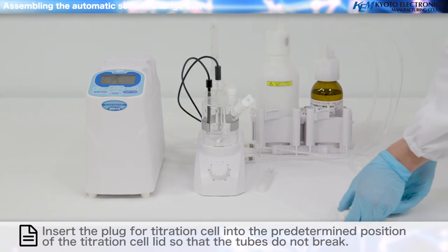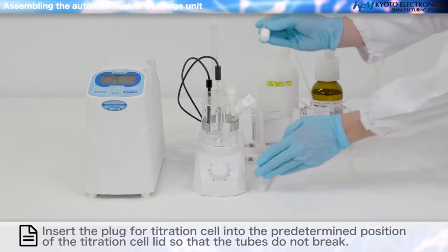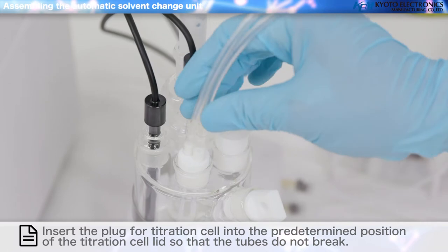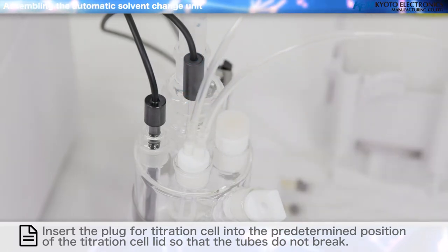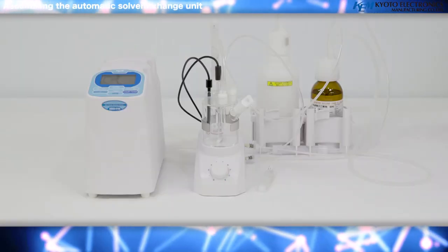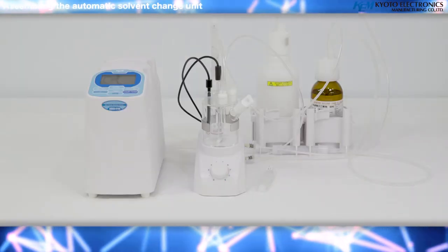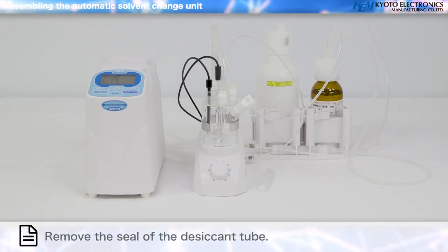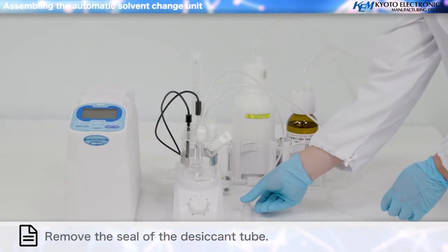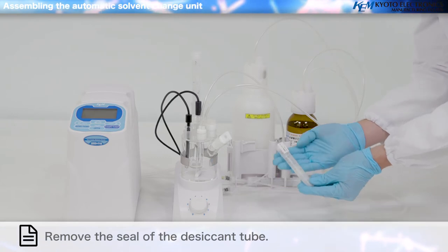Insert the plug for the titration cell into the predetermined position of the titration cell lid so that the tubes do not break. Install the port plug and the syringe inlet. Remove the seal of the desiccant tube.